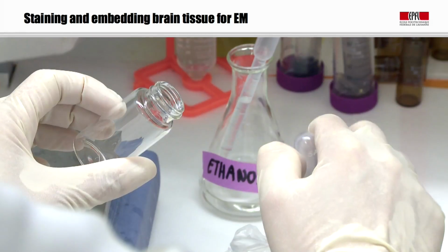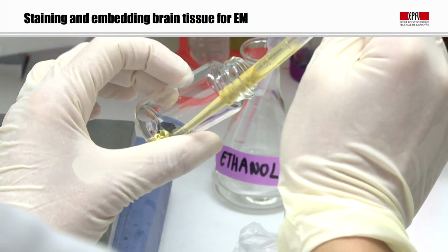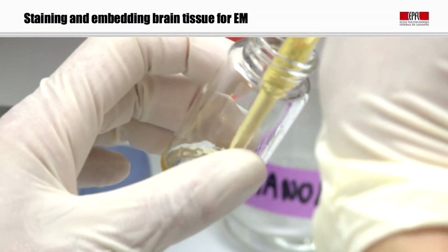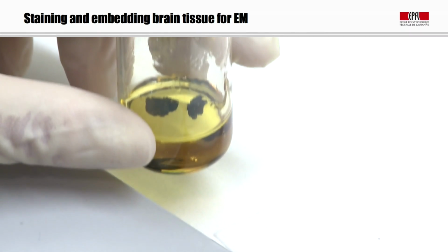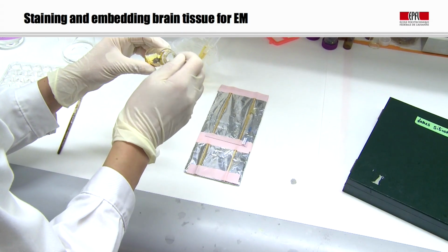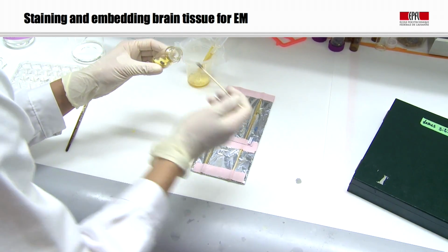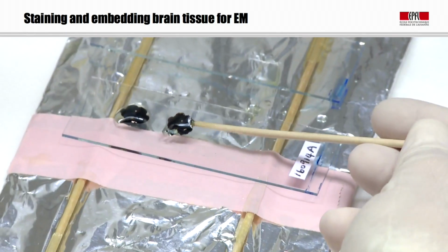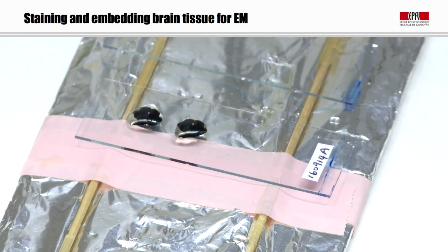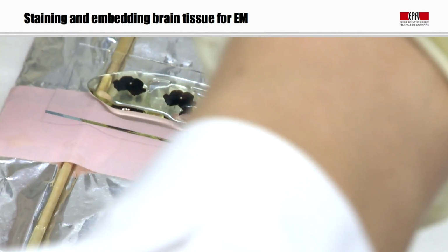And here we see we're using an epoxy resin. And this epoxy resin is mixed with the 100% alcohol. And over a process of many hours, the resin infiltrates the tissue completely. There's a removal of any of the ethanol. And this pure resin embedded sample is then placed onto microscope slides which have a mold releasing agent dried onto the surface. These are then flattened with a microscope slide on top.